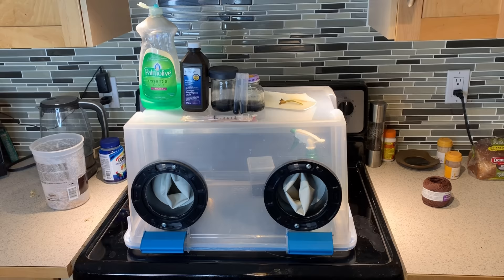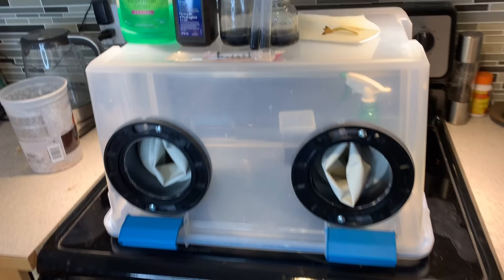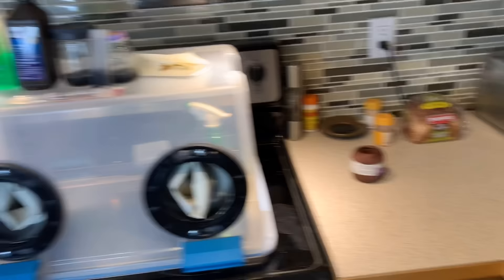So we're in the kitchen, and I thought about cleaning up a bit more, but for the sake of the tutorial I think it's important to illustrate that when I do this, the surrounding area is kind of a mess. The whole point of doing dry seed sowing for me is simplicity and ease of process. Having a glove box — which is this thing here — is essentially an enclosed workspace where you don't have a bunch of airflow around, so you're able to sterilize the inside and the seed itself, meaning you can be a human and don't have to work in a lab.